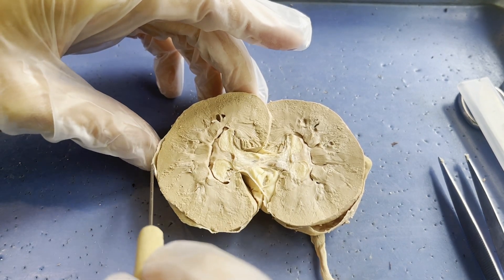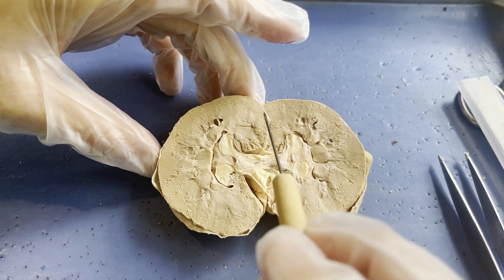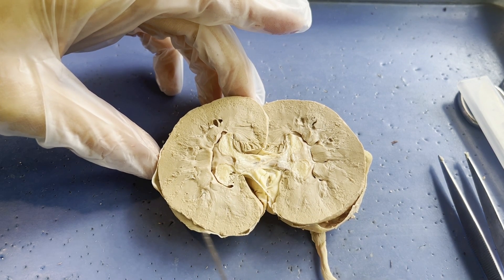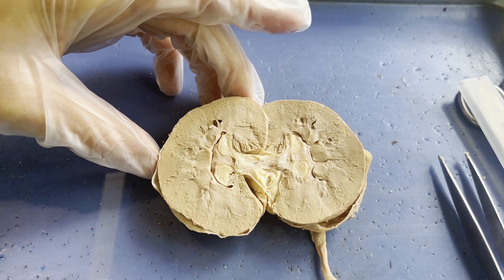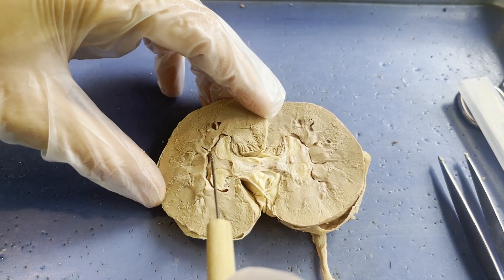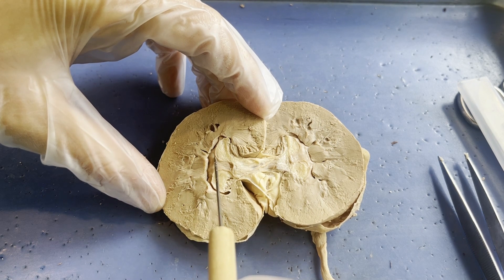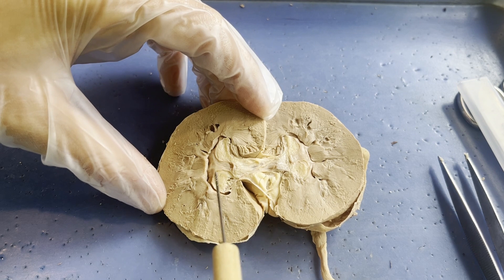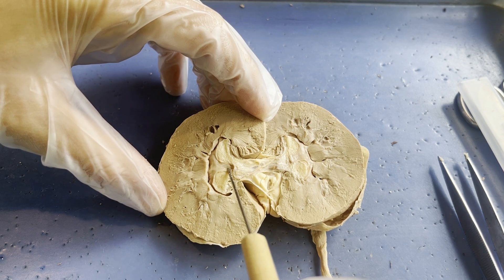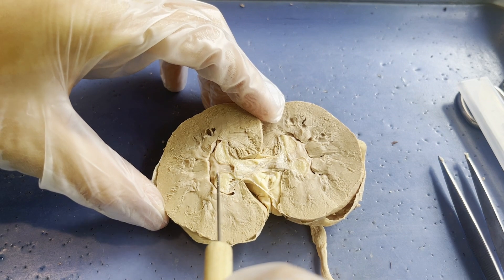Let's recap. The outermost layer is the renal capsule — that protective case. Then the renal cortex, where some parts of the nephron are. Deeper is the renal medulla, where other parts of the nephron are. The kidney completes filtration, reabsorption, and secretion to create urine. That urine travels down the collecting ducts and comes out through structures called calyces — where urine goes from the collecting duct into the next structure — which is the renal pelvis. This is where urine from all those nephrons converges and collects, though it doesn't stay there long.